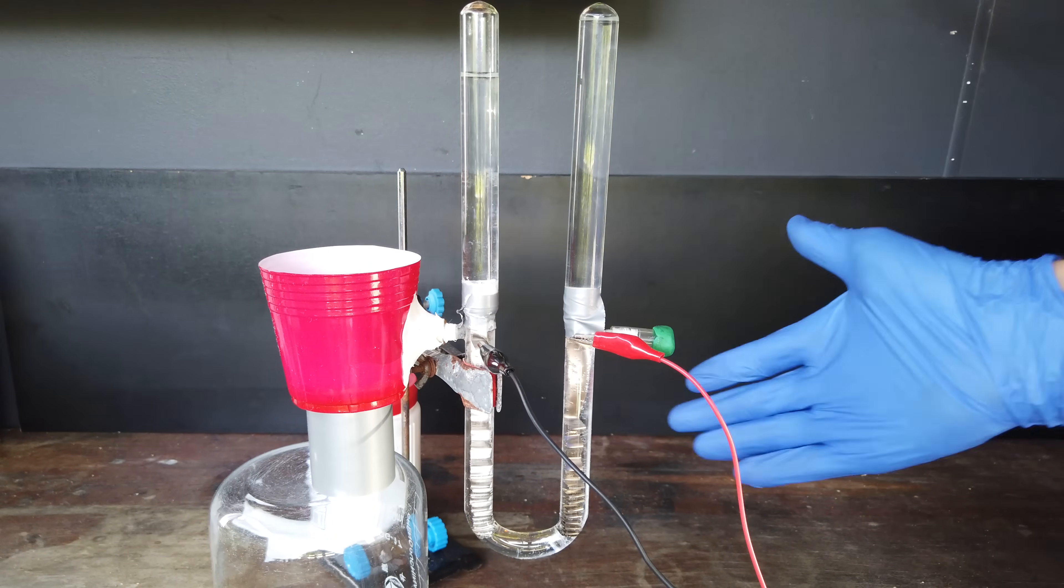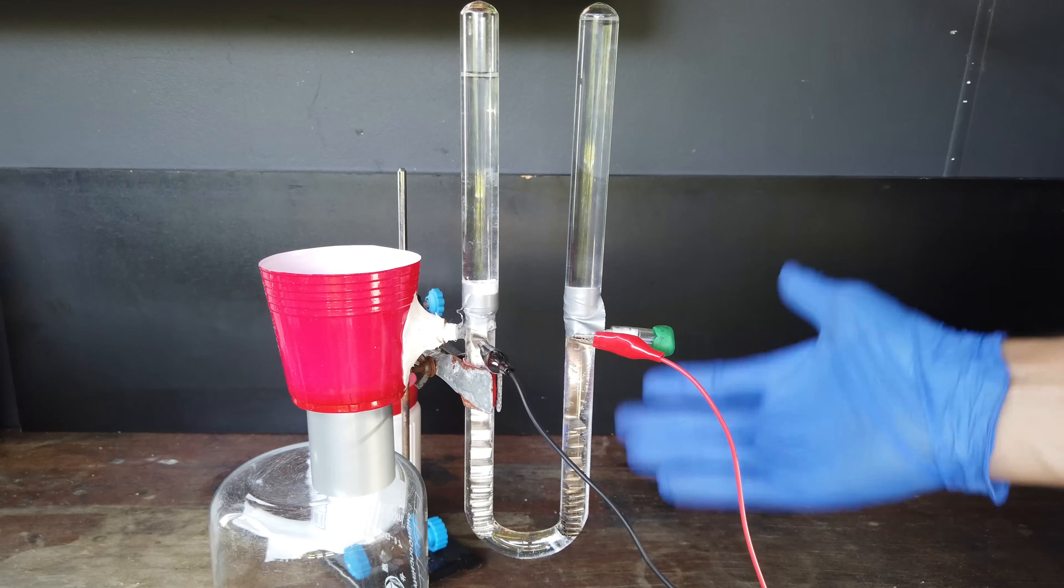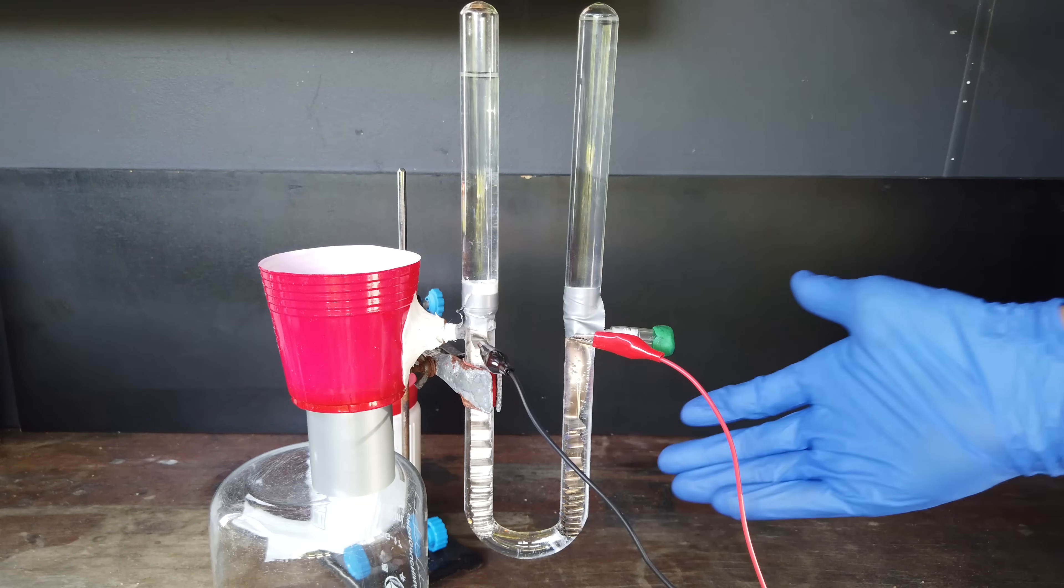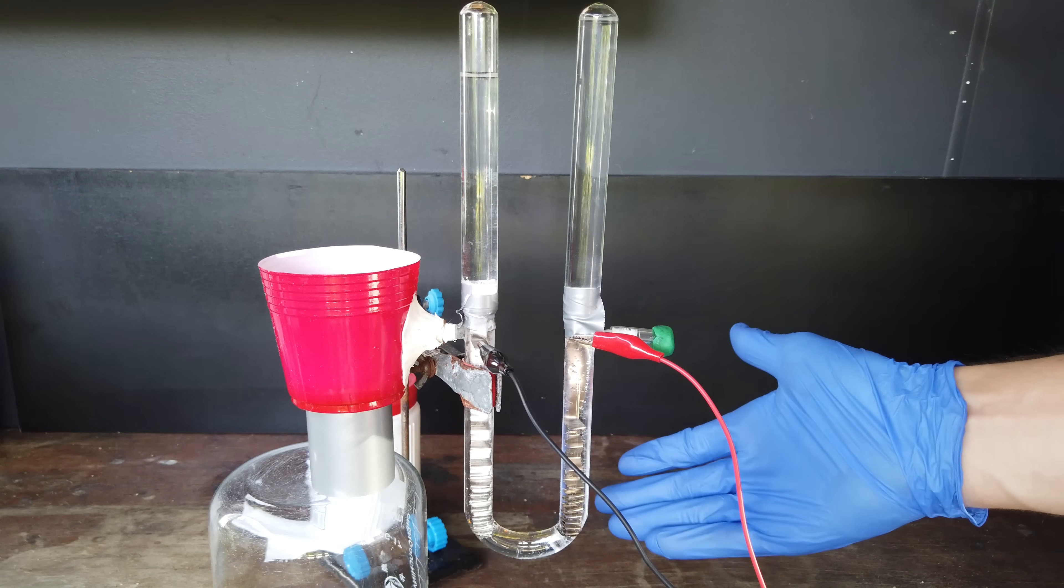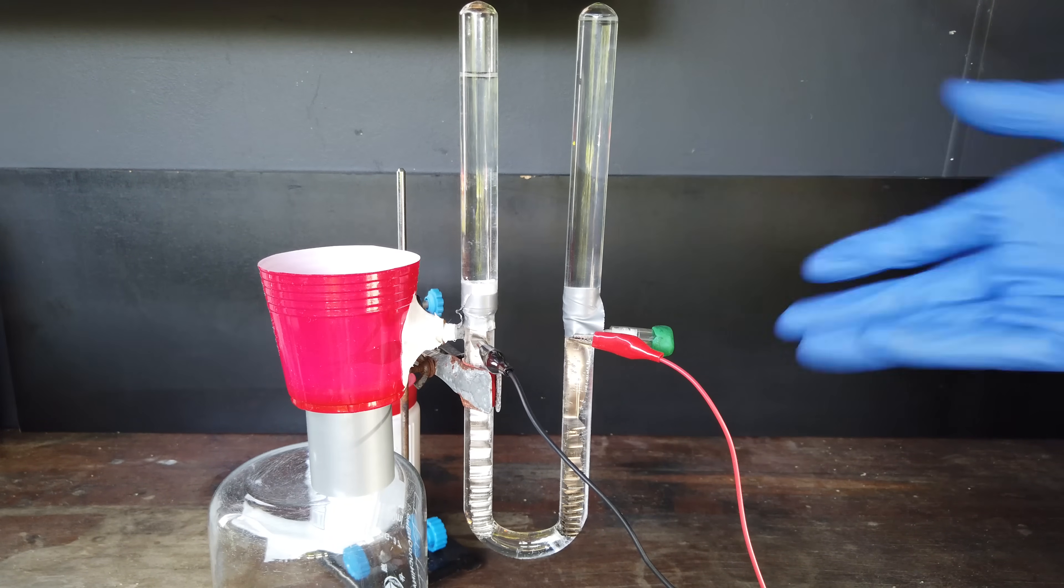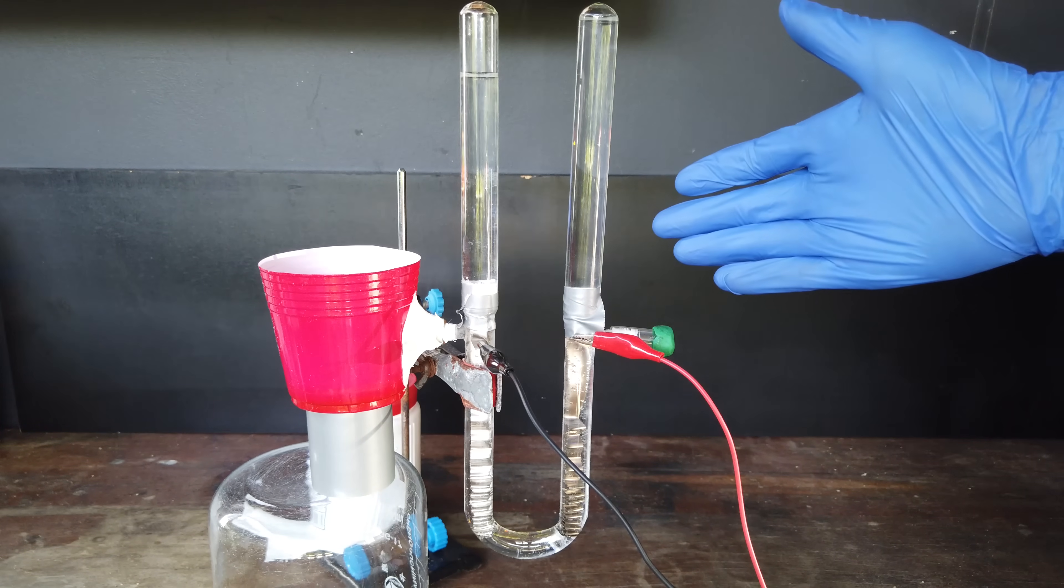But if the process of generating nitrogen, even just on this demonstration scale, requires me to build a custom cell for this electrolysis procedure, I'm not going to put that much effort in. I mean, nitrogen isn't really that special. I just really wanted this to be a simple demonstration. So, we are just going to completely give up here.